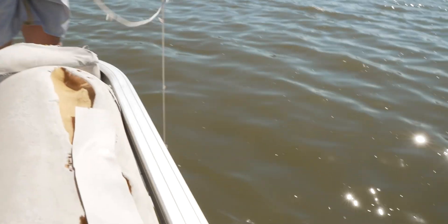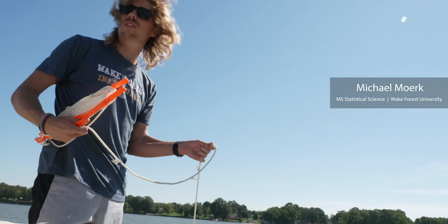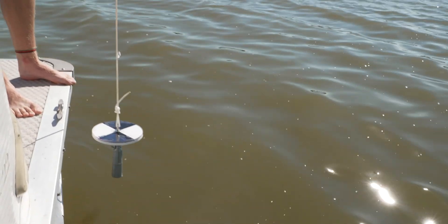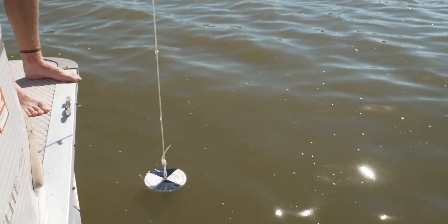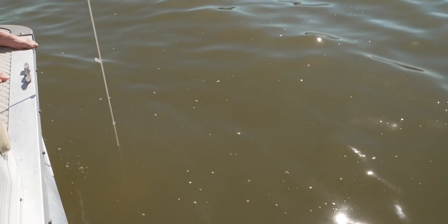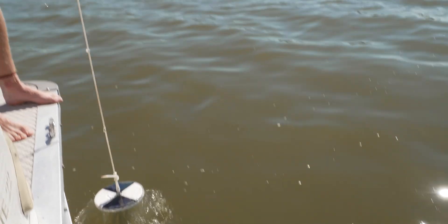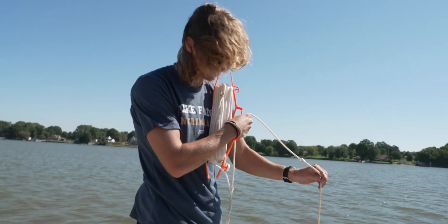This is a Secchi disk — it's a classic way of measuring the clarity of the water and how turbid it is. We drop this disk into the water with a weight on it and see how far it goes before we can't see the distinction between the white and the black anymore. Right about there is where I can't see the disk anymore, and based on the measurements on the side, it was about 1.5 feet. We record that as the Secchi disk depth.